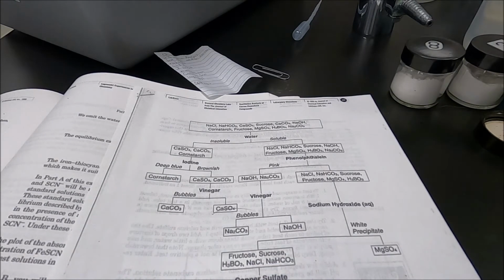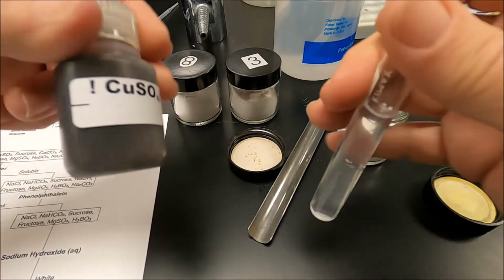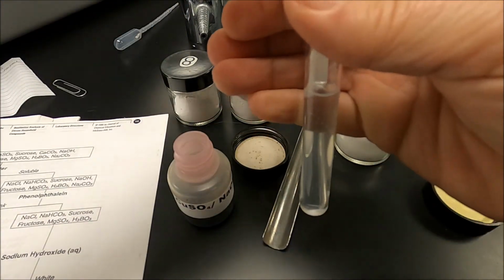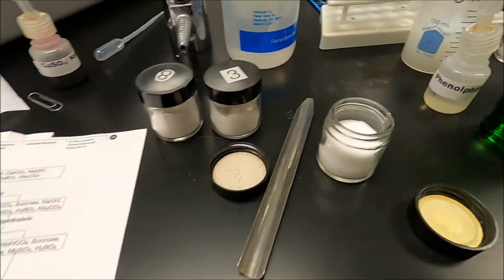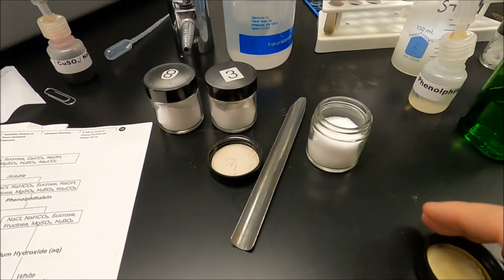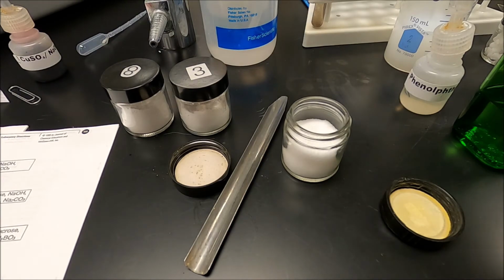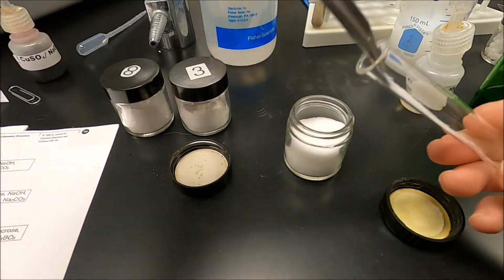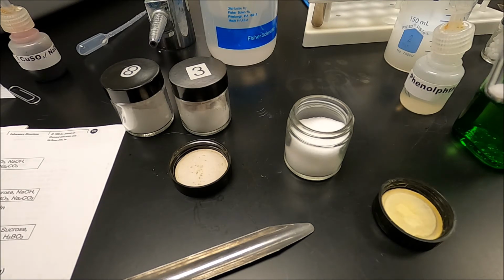So I'm going to get another test tube. Well, I can take the one that I have sodium hydroxide in, and I'm going to add the copper reduction solution. Okay? Now, this one actually has to sit for a little bit. So we're going to sit it right there and we're going to watch it. And while I'm waiting for that to happen, I'm going to try adding some vinegar to a little bit of the solid. So I'm going to get another test tube because I'm impatient, and I'm going to add vinegar to it. Okay, so where's my vinegar?